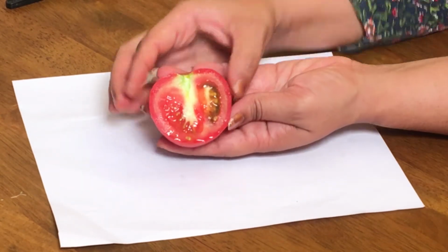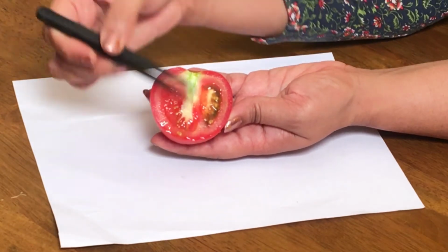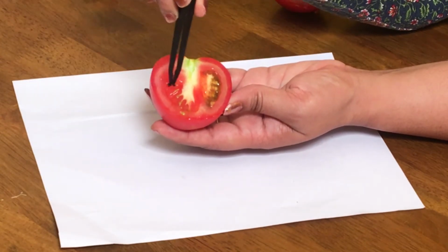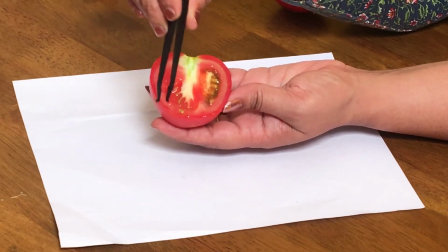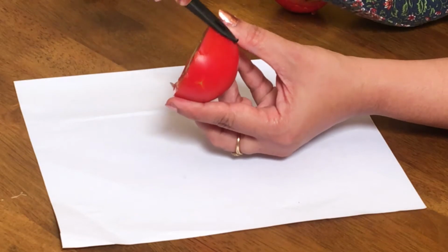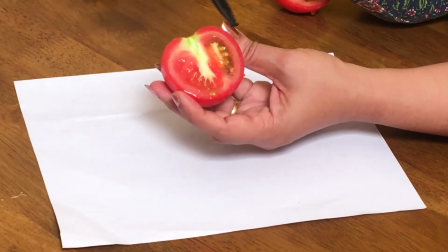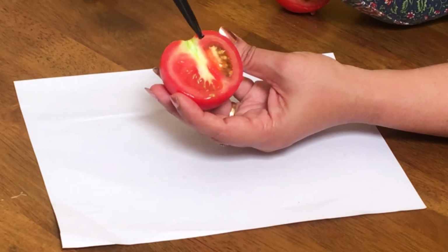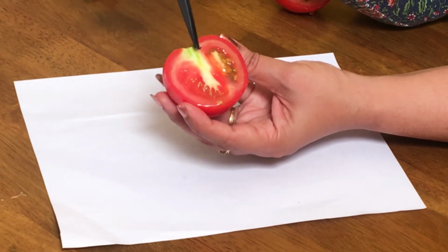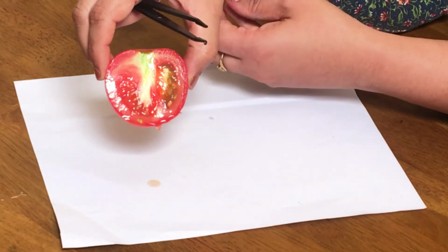This is tomato. When you cut open, there is a longitudinal section of tomato. So this entire area, this reddish area, is all called the pericarp, and the pericarp is divided into the outer, very thin and shiny epicarp. Then this area is called the mesocarp. Since there are a lot of seeds inside, it's called a berry. Even tomato is also a berry.